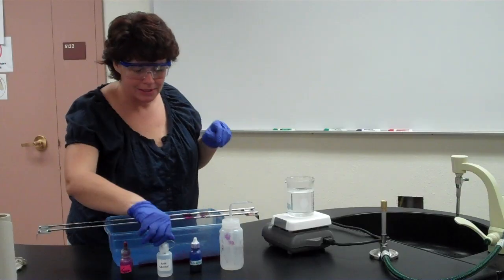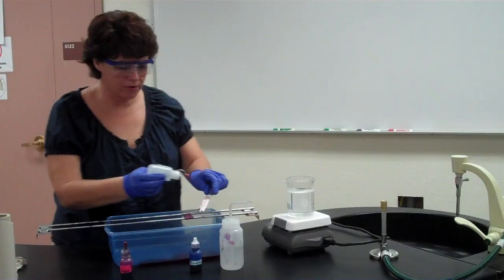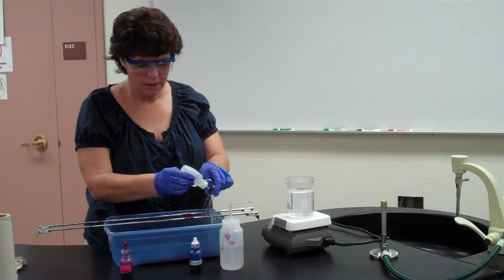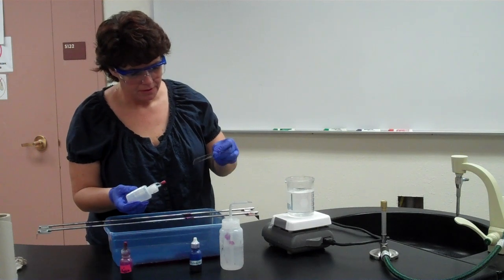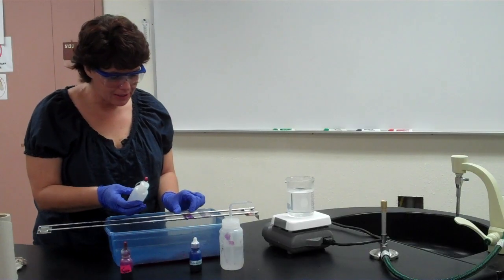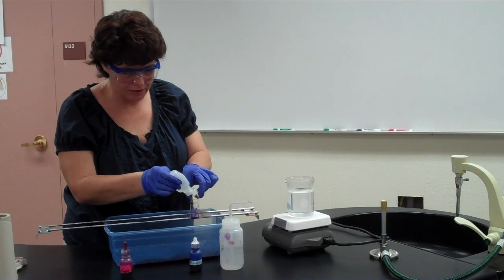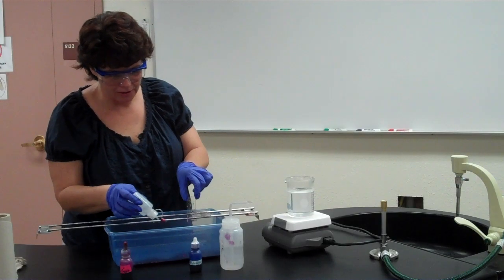Now our decolorizing step is similar to what it was in the gram stain. We're going to squeeze the alcohol on there, the acid alcohol, just like we did before, until it almost runs clear. Some of us, like myself, I believe I've washed the color off of the back. You want to do that until it begins to run clear. Many of us realized with our gram stain that we had decolorized too long because our gram-positive cells were pink. So the same thing with this, you don't want to decolorize too long.